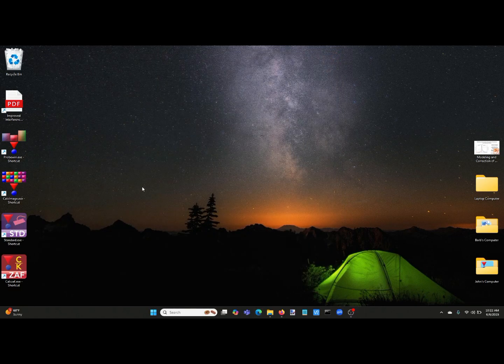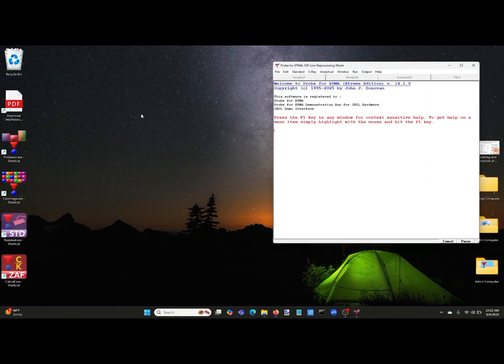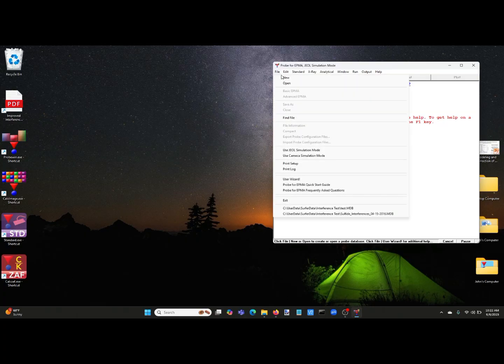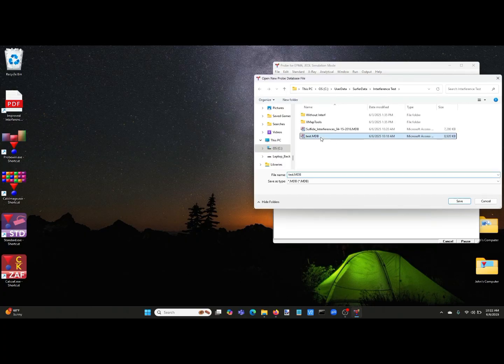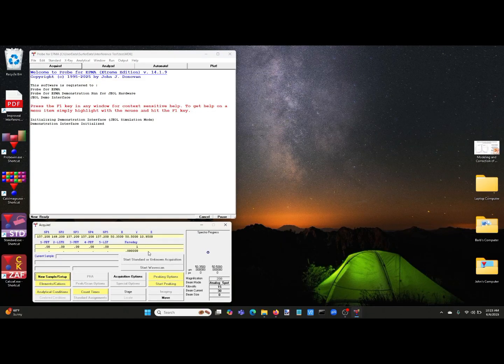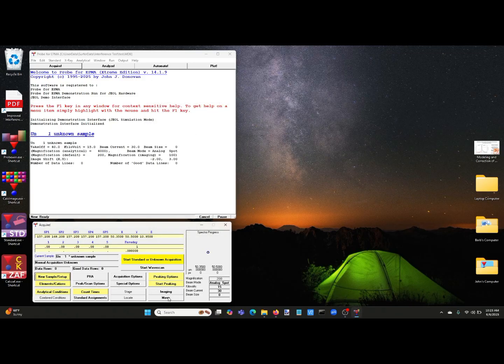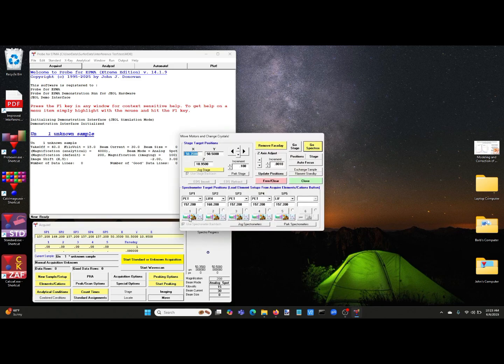So let's start. We're going to run Probe EPMA. We're going to make a test run just to demonstrate how we set up these runs. This is for JEOL hardware. And we'll make file new. We'll just select a test name and create a new run. And then what we're going to do is we're going to add the elements. First make a new sample, an empty sample. We'll select some elements.